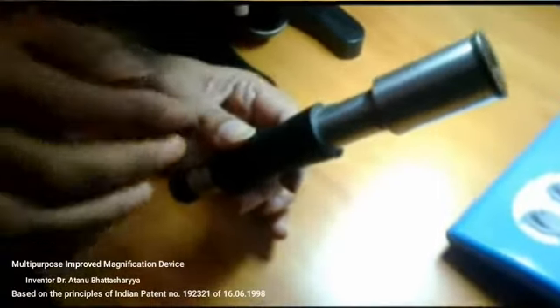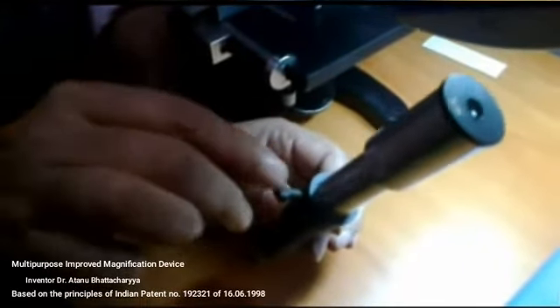This is the T2 tube, the black tube, and it is actually the holder tube. Through this T2 tube, the T1 tube can be moved upward and downward, and it can be fixed at any position by this screw, which has been called the S1 screw. By this screw, it can be fixed at any position.